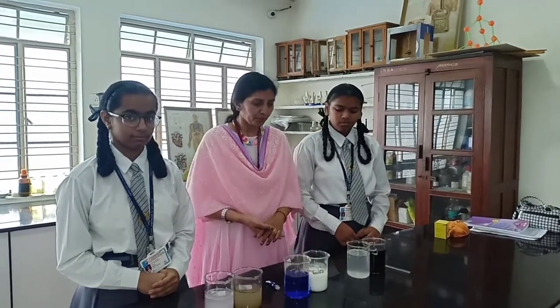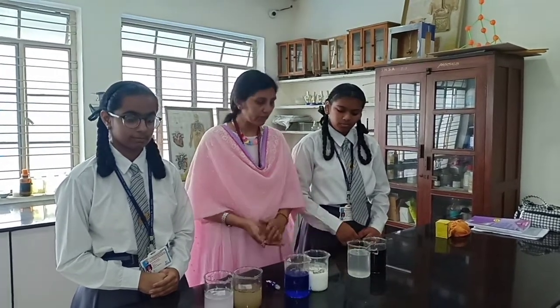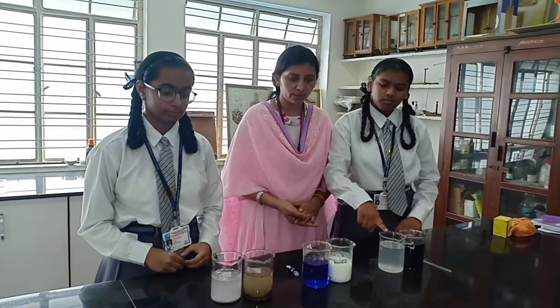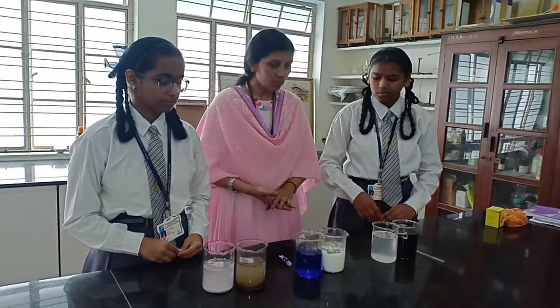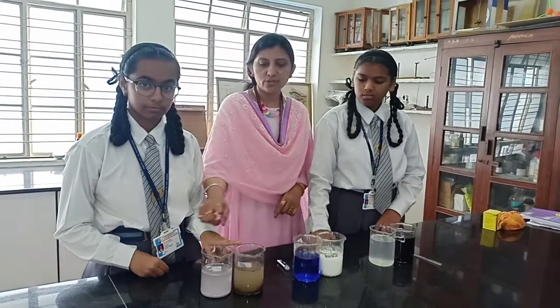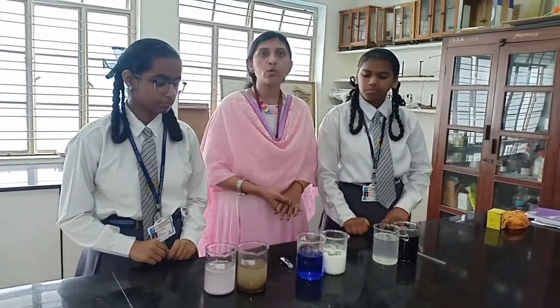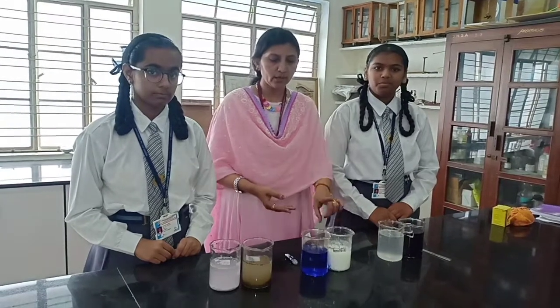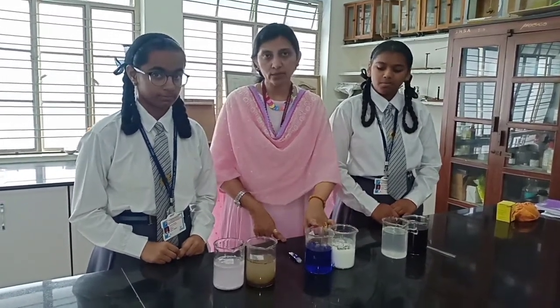Today with the help of Sakshi and Pala we are doing this activity. We have made two solution samples: potassium permanganate solution and salt solution. Here we have made the suspension — that is the sand solution — and here we have made the chalk powder suspension. The third one is the colloid solution, and in the colloid we have taken two samples: milk sample and ink with water.